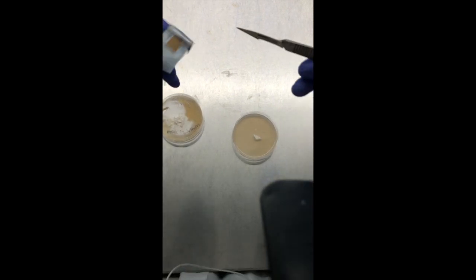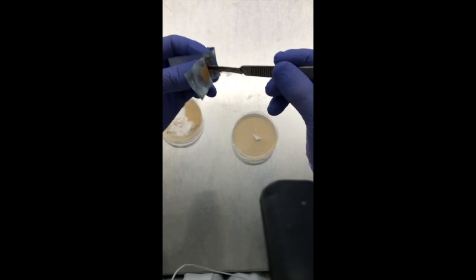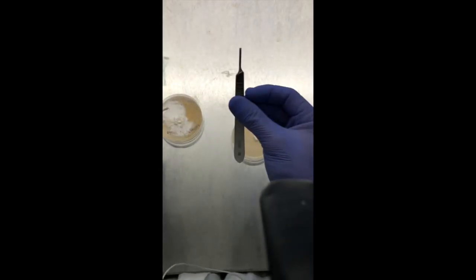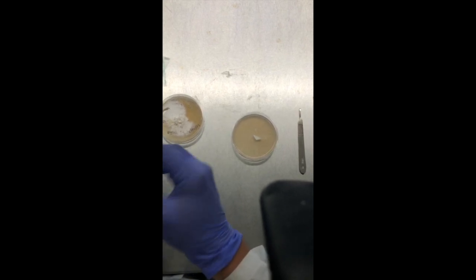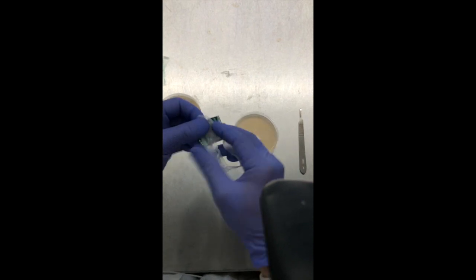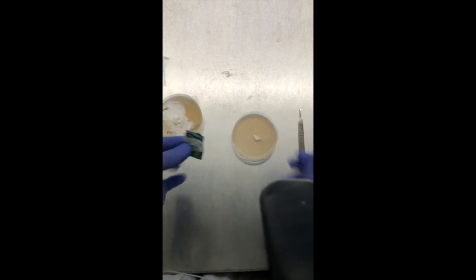To take this blade off, you want to be very careful — put it back into that cardboard area, then take your thumb and lift up and pull. That way you have a sharps container ready to go. I fold it up like this and throw the old parafilm over it so you're really protecting that sharp blade. Then it's good to go in the sharps bin.